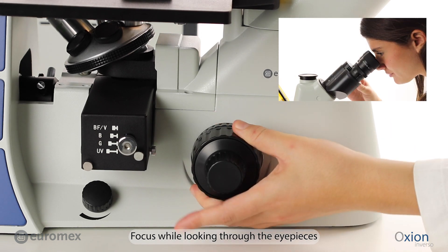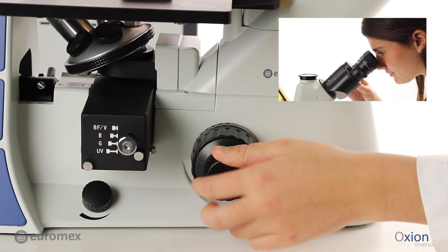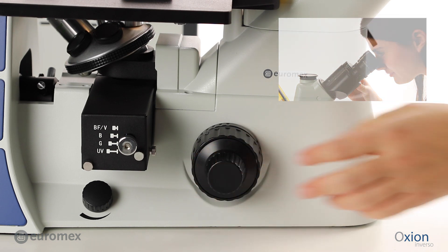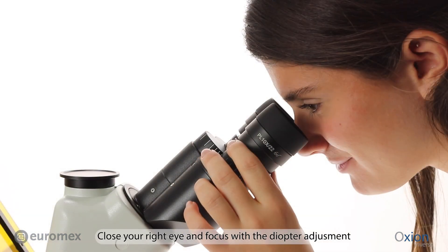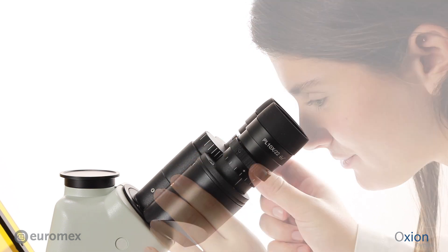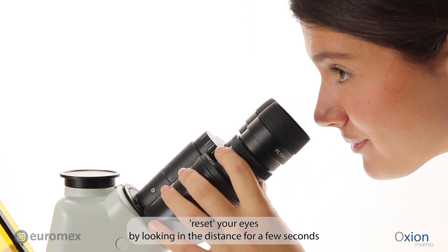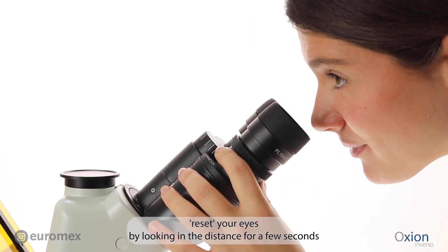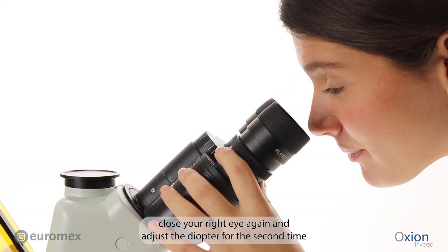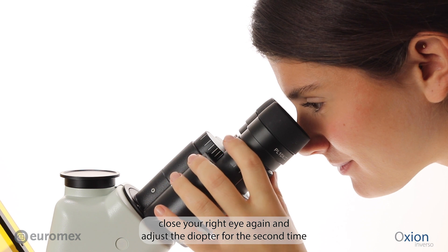Focus while looking through the eyepieces. Close your right eye and focus with the Diopter Adjustment. Turn the Diopter back a few divisions. Reset your eyes by looking in the distance for a few seconds. Close your right eye again and adjust the Diopter for the second time.